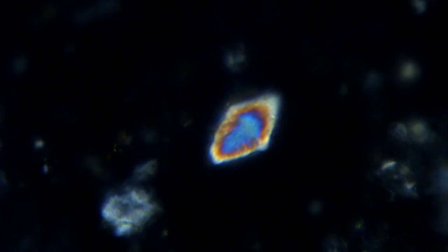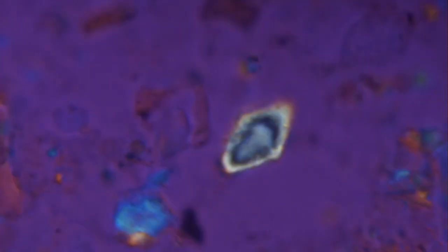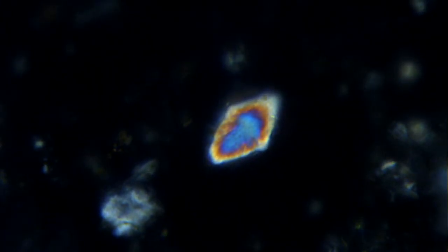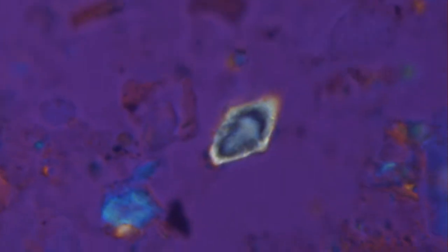Note that the first order white retardation color of its thin edges becomes first order yellow. The thicker reddish purple area, with a similar retardation color to the gypsum plate, by subtracting, cancelled each other out, and so it behaves similarly to an isotropic or nearly isotropic substance, and so displays a darkish color.